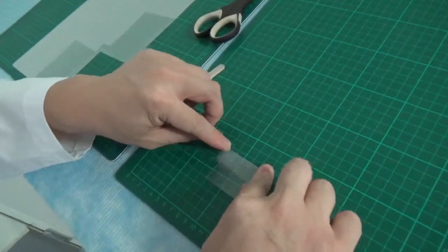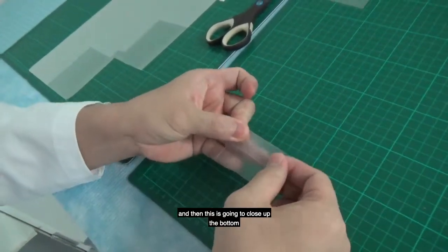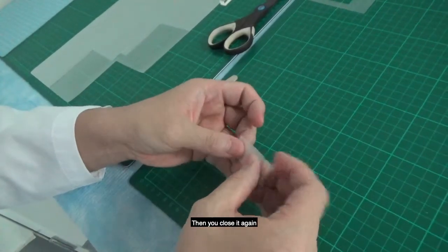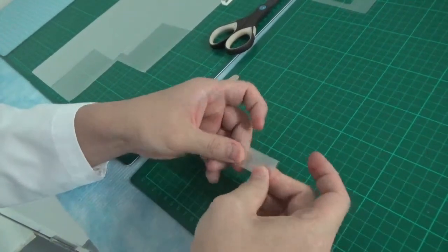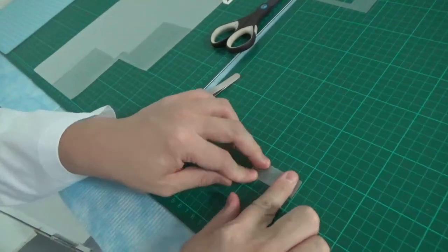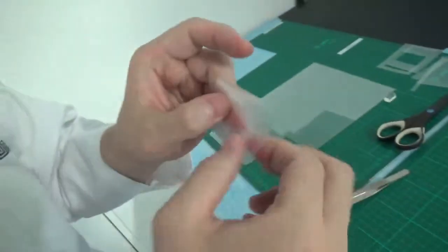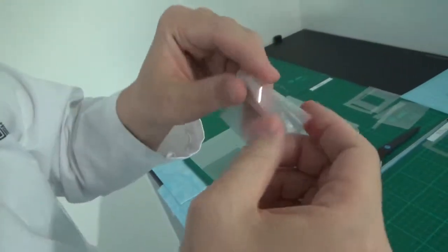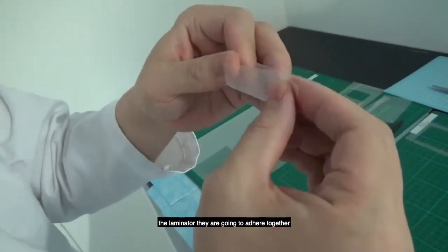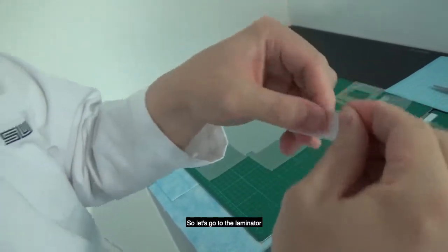So you fold this, and then this is going to close up the bottom parts of the channel. Then you close it again. That is going to provide the inlet and the outlet for this channel. And you can see which side is adhesive. After you place them into the laminator, they are going to adhere together, creating a microchannel. So let's go to the laminator.